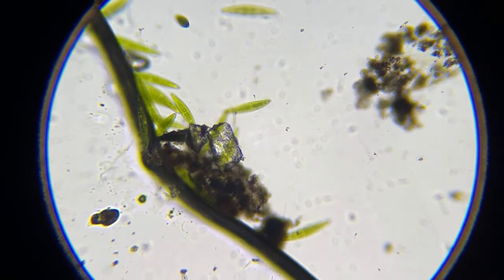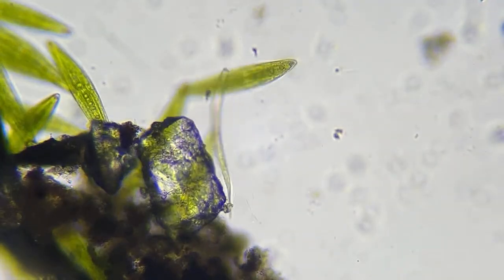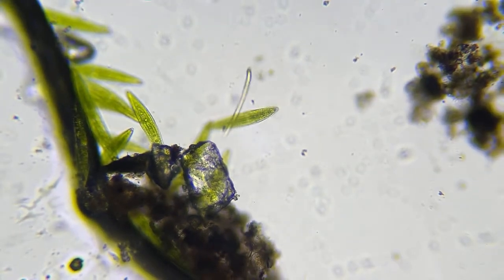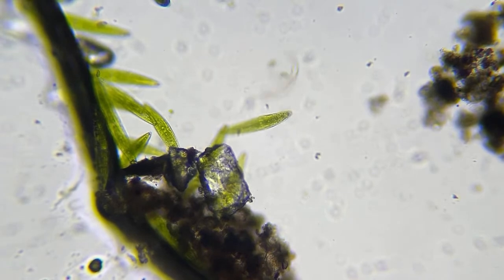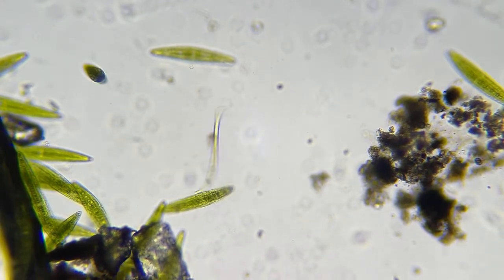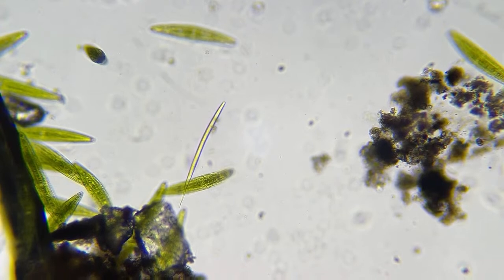So, I mean, usually anytime you're digging in mud, you're going to get a hookworm. I tell you what, I think it's the most prevalent animal I ever get when I'm doing stuff. Hookworms. And they never stop moving. They're nuts. Yeah, Roy. Yeah, Jermaine, it's awful.